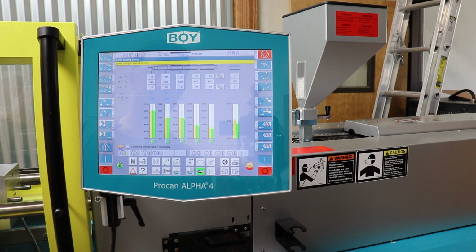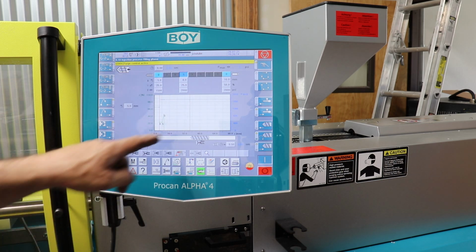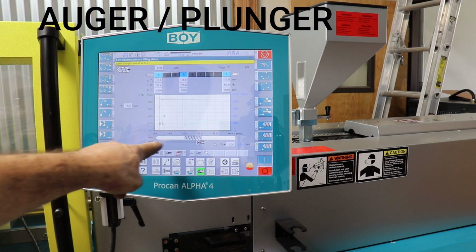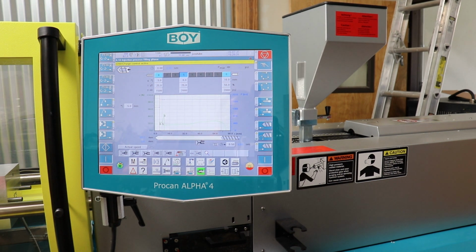We'll double check our temperatures. Yep. So you can see how the molding machine is backing the nozzle up with this depiction here, and now it's going to squirt all the plastic out. And you'll see some smoke rising in the background. That's just old plastic. And this process will happen a few times.